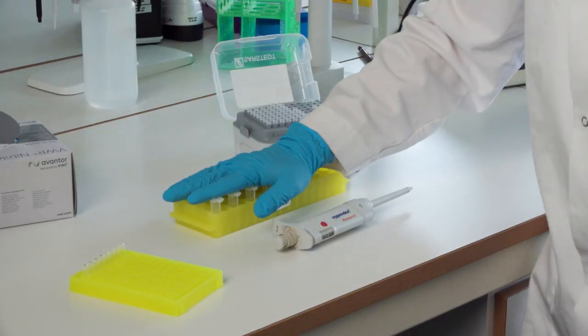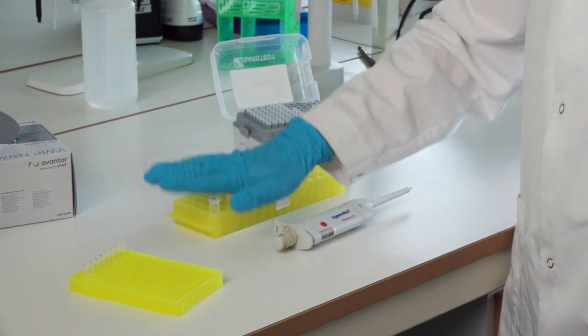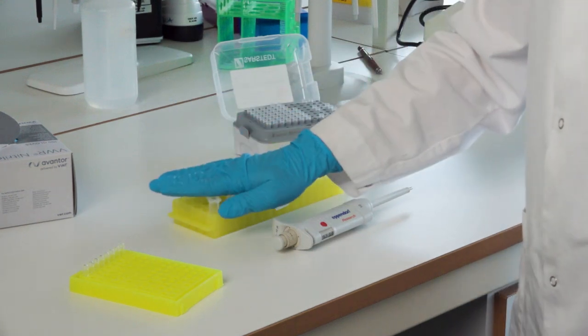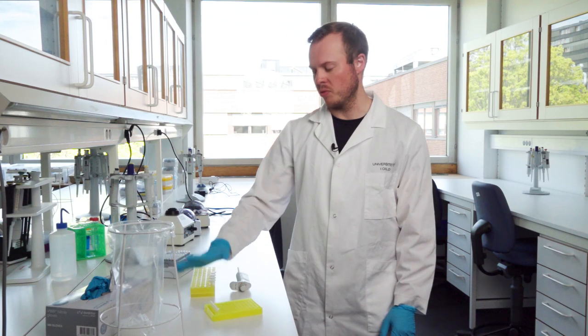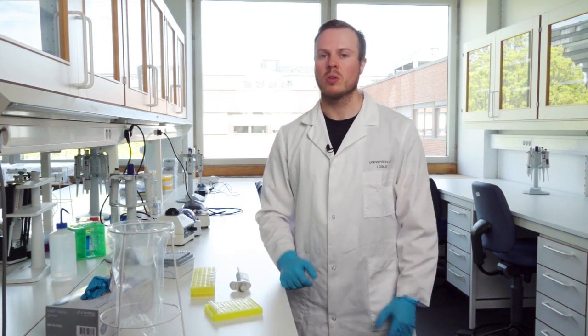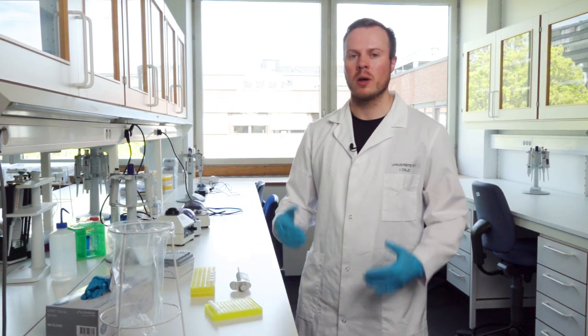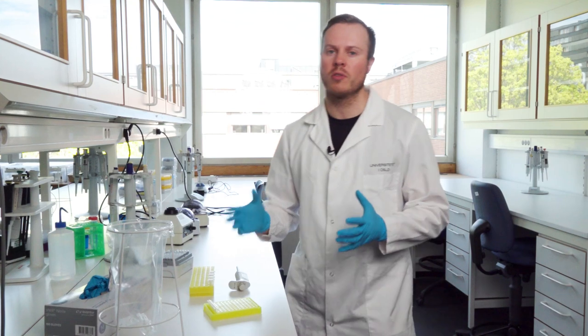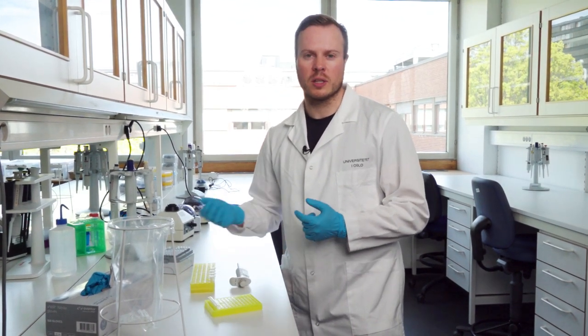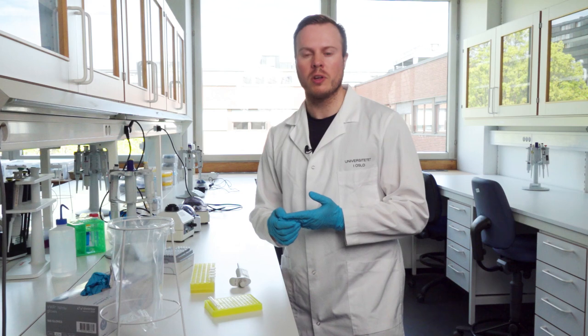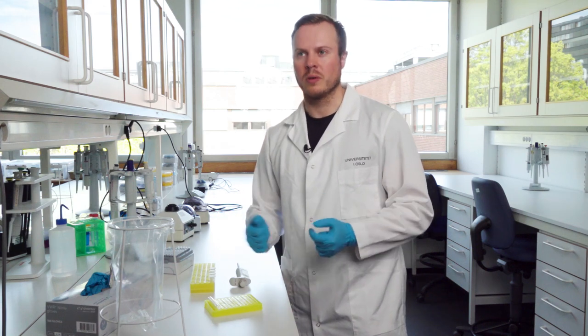One thing you should also take into account is that it can be smart to spin down the cleaned PCR-1 products before you start pipetting. But always spin down different tubes as often as you can, just to stop contamination from getting in the lid that goes onto your fingers and then onto another tube.